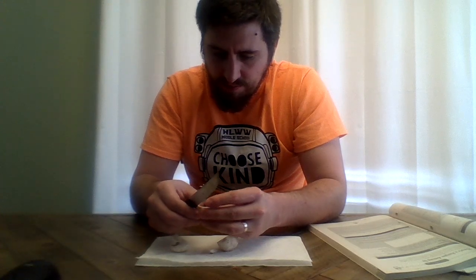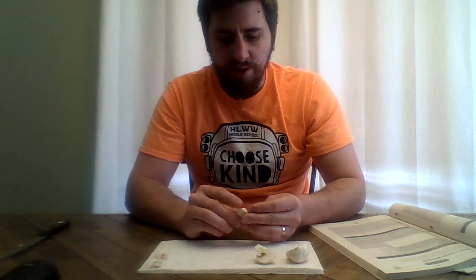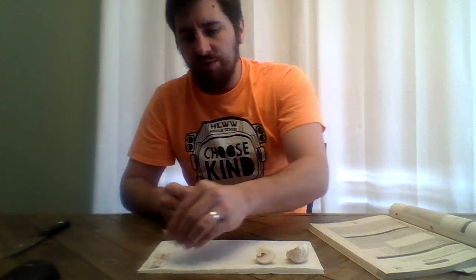Don't do this at home, folks, but I'm gonna cut the stem off, and then I'm gonna peel back a little bit of the cap. And don't do this at home. If you do this at home, like you want to do your own dissection, use a plastic knife. If we were in class, we'd be using a plastic knife. I do not have a plastic knife, and obviously, I trust myself with a regular knife, so I'm going to use that. But use a plastic knife if you want to do this at home.